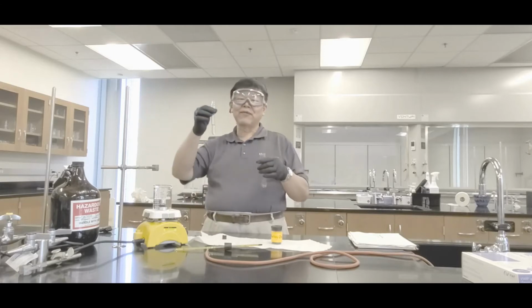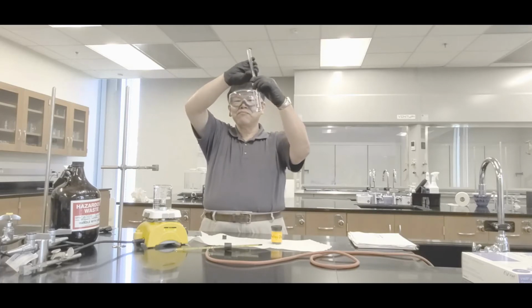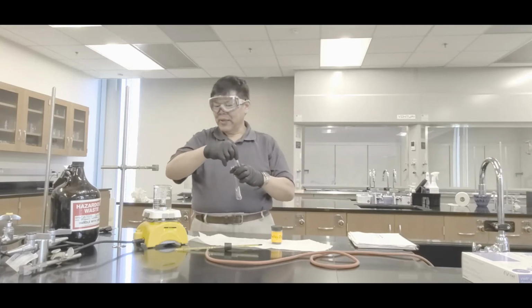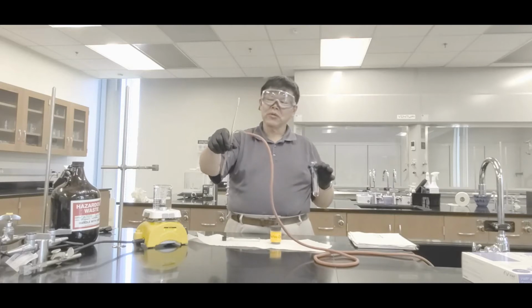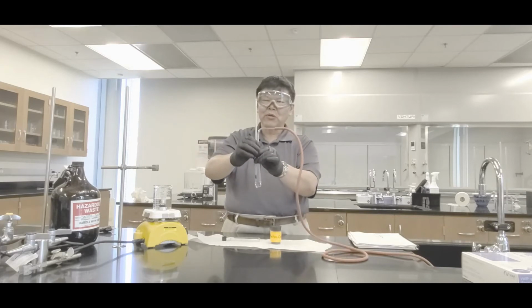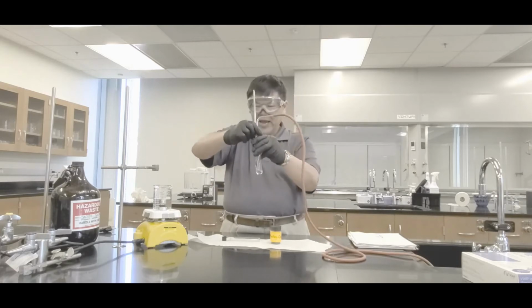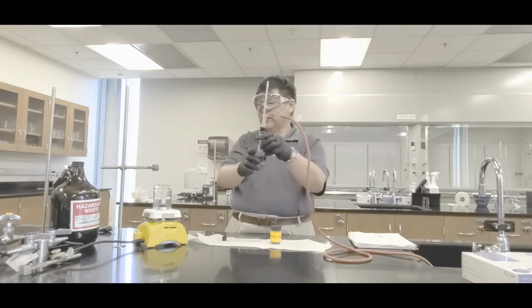So, here we go. You already got a portion from the density go to index of refraction. This one right here, just pour it all into here. Yeah? There we go. Close that. Then what you want to do is put the rubber stopper on. Hey, you guys, precaution. Hold it by the rubber stopper and push in and twist. Don't grab the elbow or the thermometer because if that breaks, it'll cut your hands. Understand? So hold the rubber stopper, push and twist.